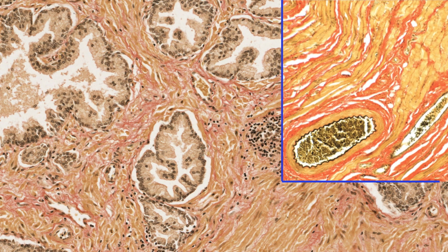Here's a marvellous image. The Van Gieson staining technique is probably better shown in this inset image. What you see on the bulk of this image is yellow stained skeletal muscle, enclosed by little fine strips of coverings of red stained collagen or connective tissue. And the stained connective tissue elements divide these skeletal muscle fibers into muscle bundles or fascicles. You'll learn about this when you do muscle tissue in more detail.